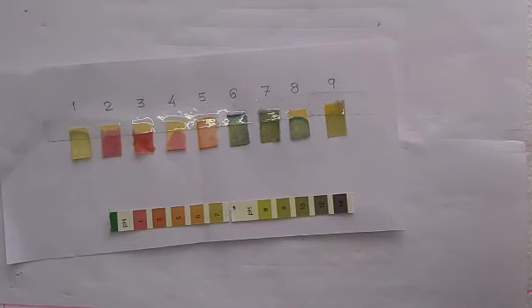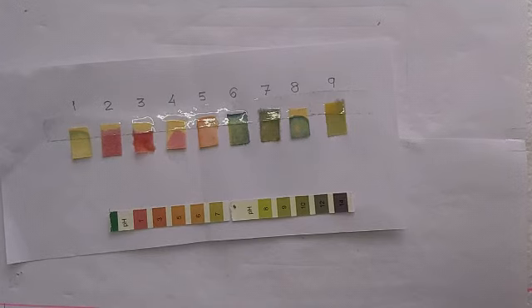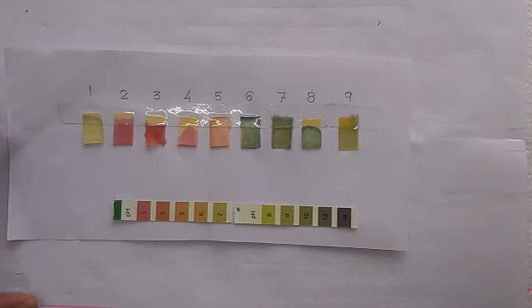Actually, magnesium hydroxide, I made it by burning magnesium ribbon and then dissolving those ashes into water, and it shows it is strong. And then another one, eighth number, is potassium hydroxide KOH. It is also a strong base. And then at ninth place we have calcium hydroxide, not so strong. This is how the strength of an acid or a base is generally observed or compared using universal indicator.